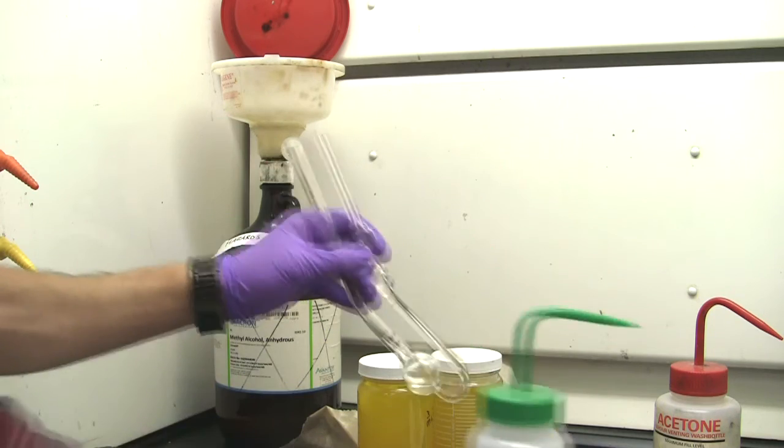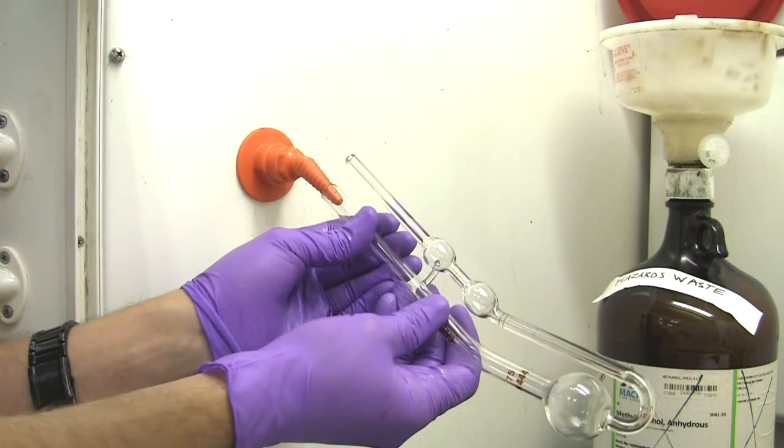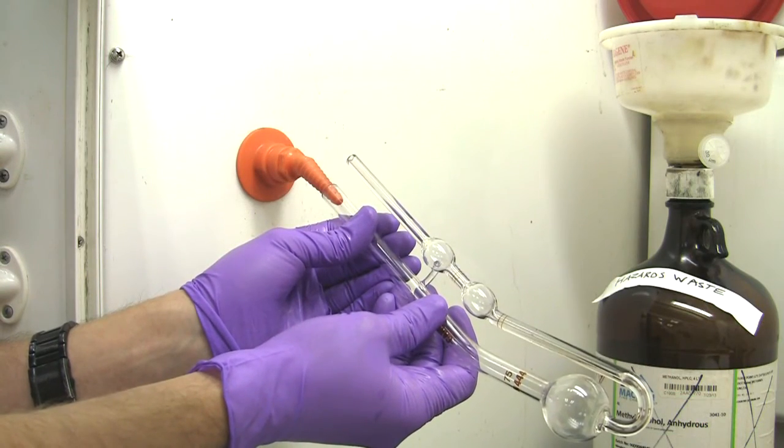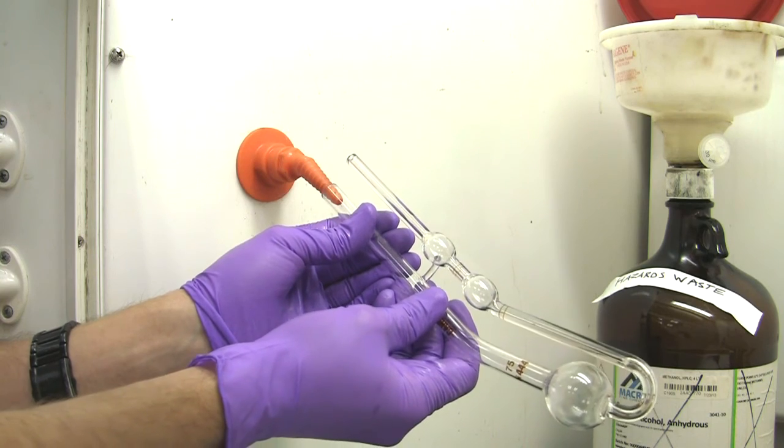Clean the viscometer using suitable solvents and by passing clean, dry, filtered air through the instrument to remove the final traces of solvents.